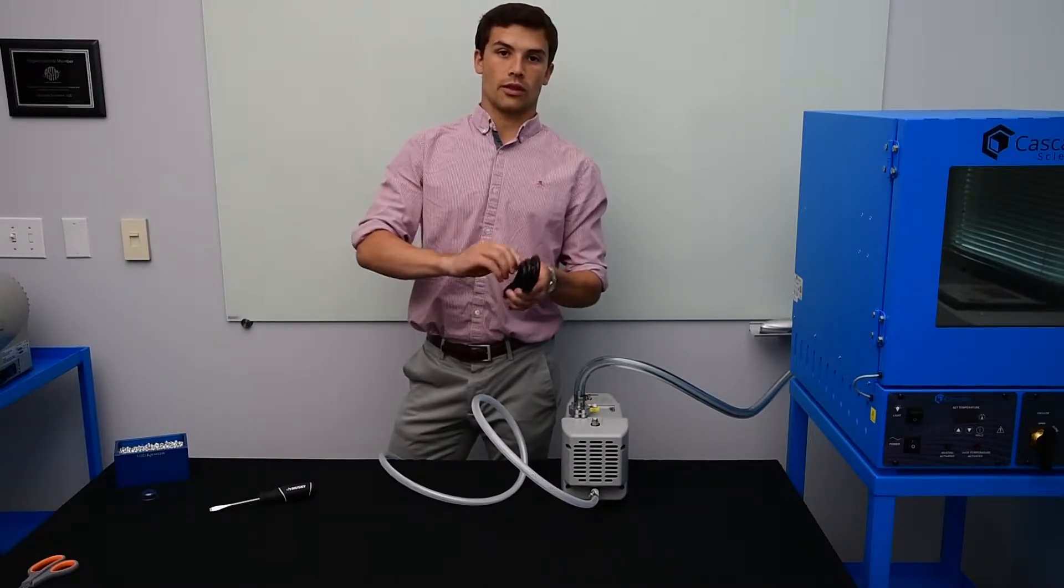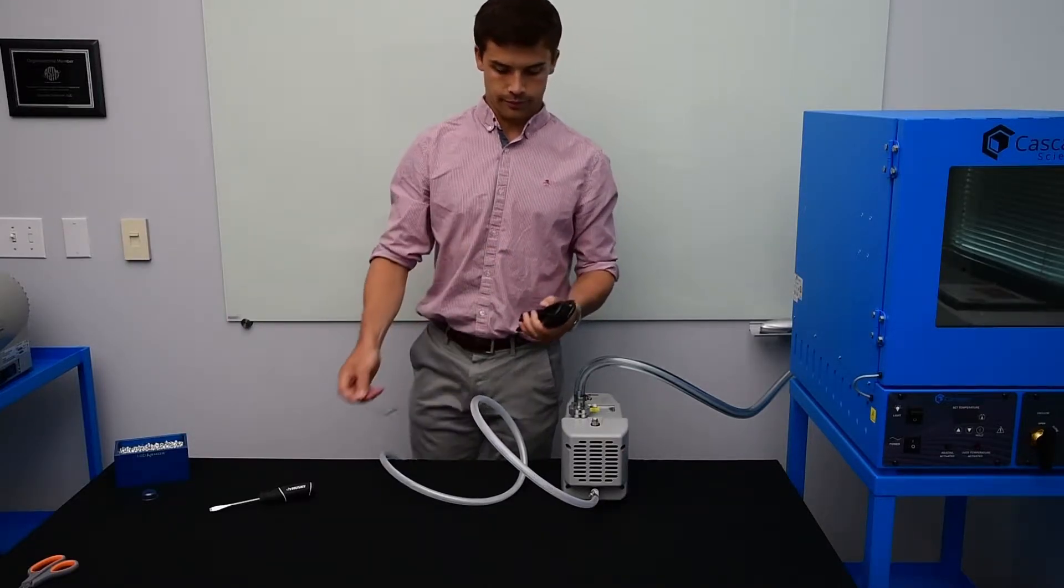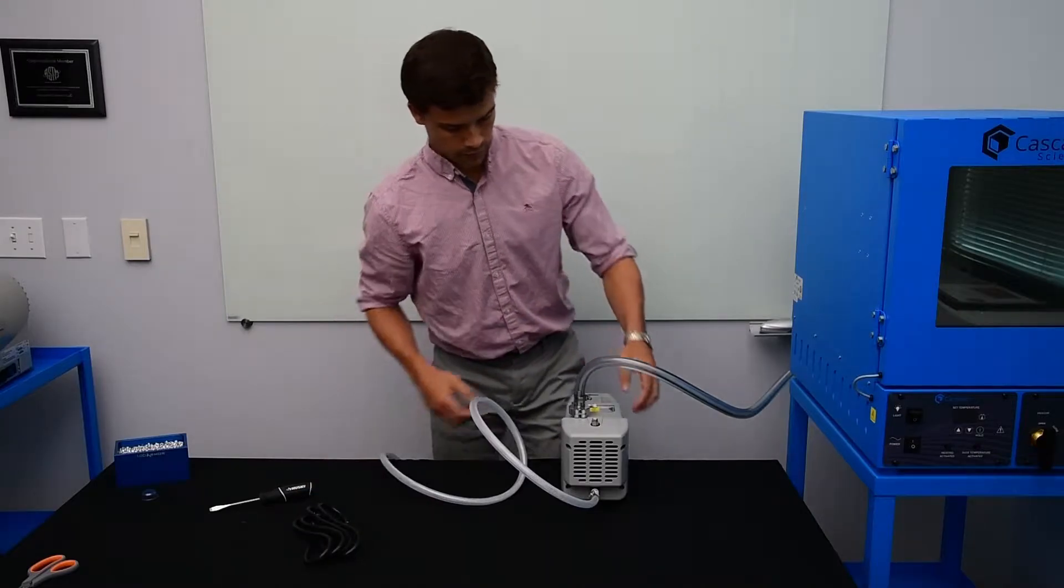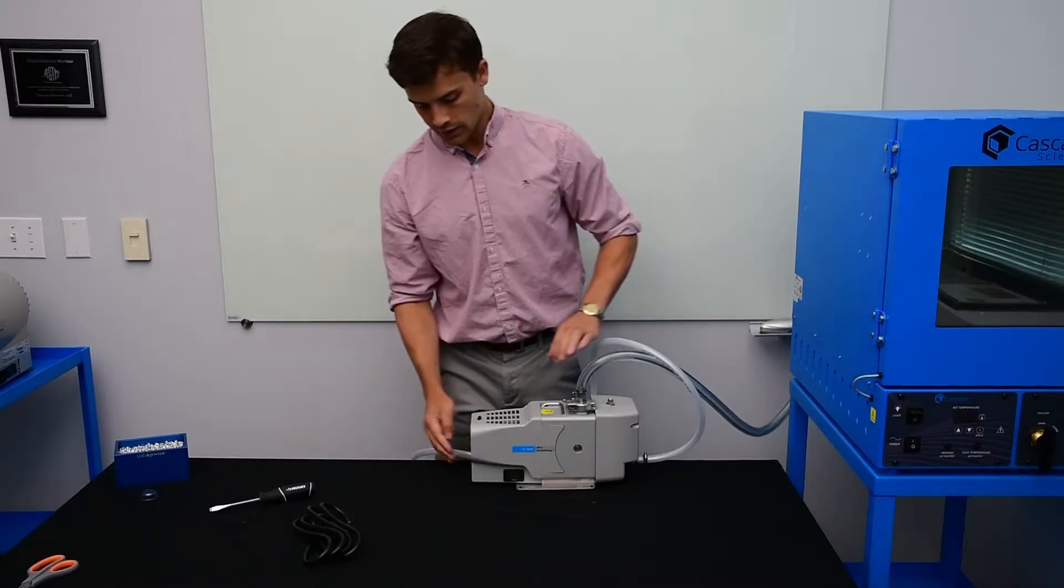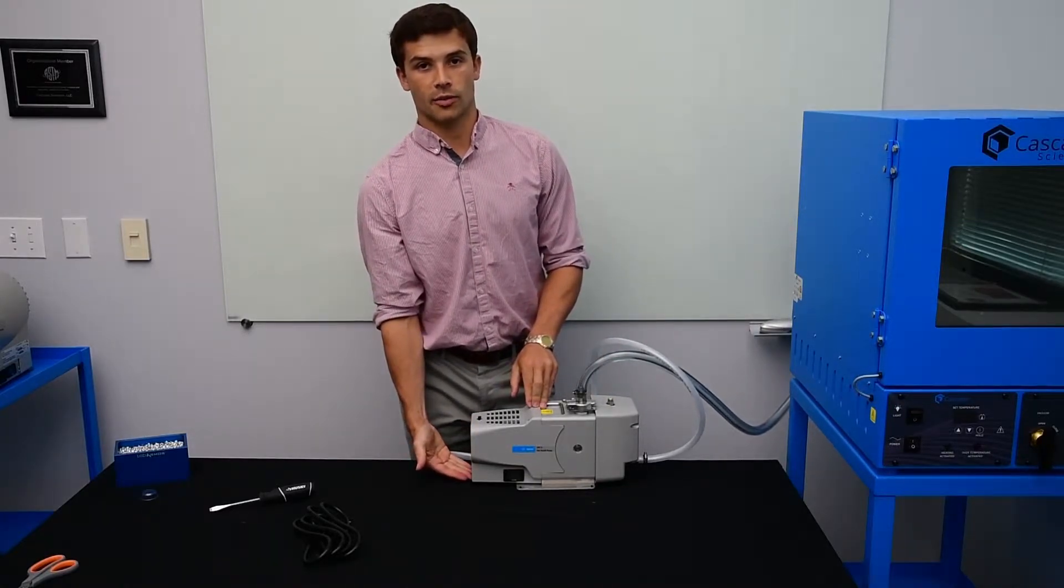Next, we'll install the power cord. This is located at the rear of the pump.